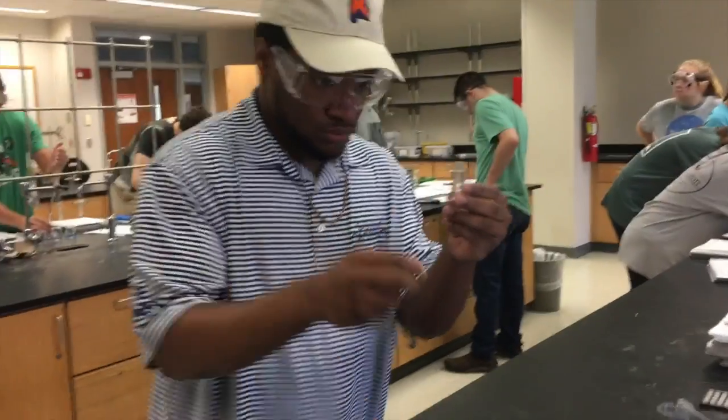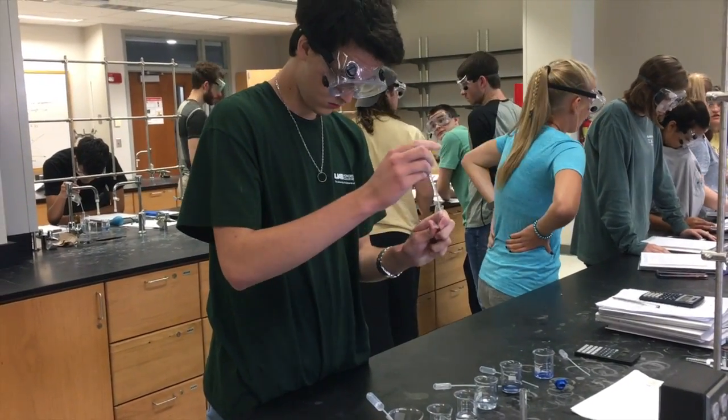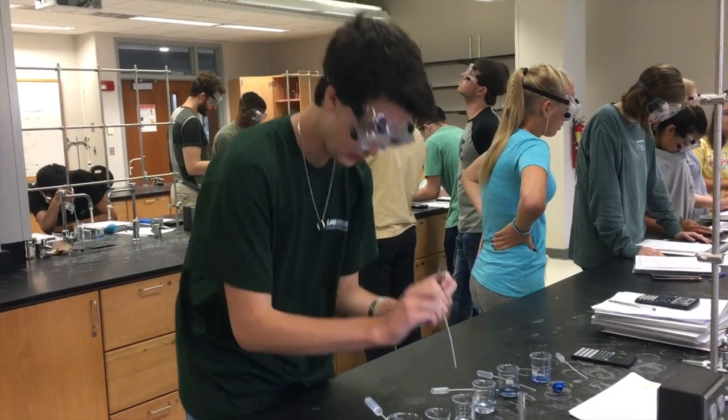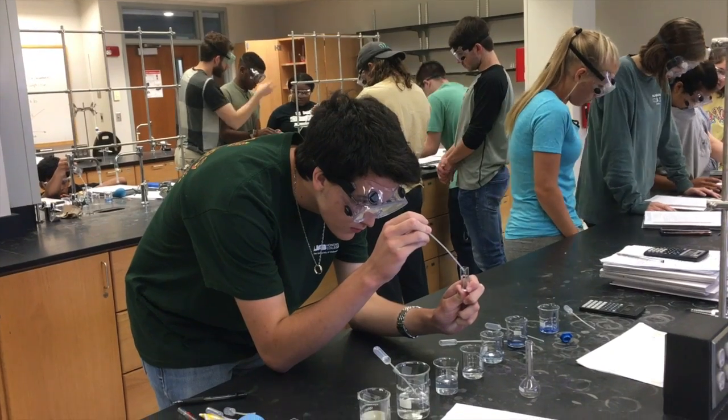representing a quality. The purpose of scanning across all wavelengths is to find what light wave best measures the absorbance for the stock solution. The lambda max will give you the wavelength that should measure absorbance the most accurately.